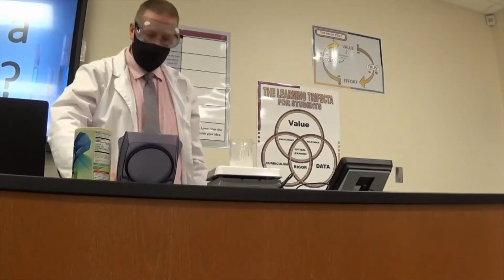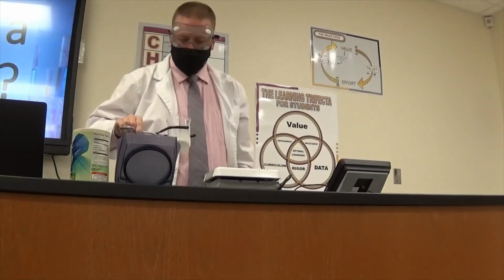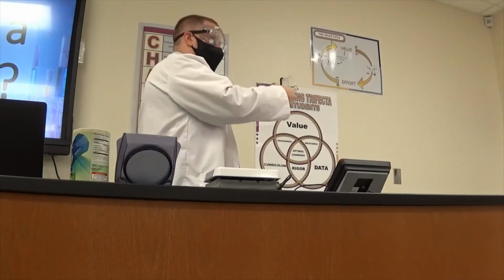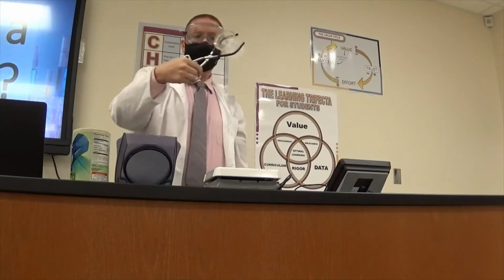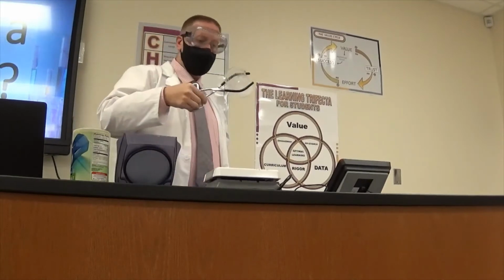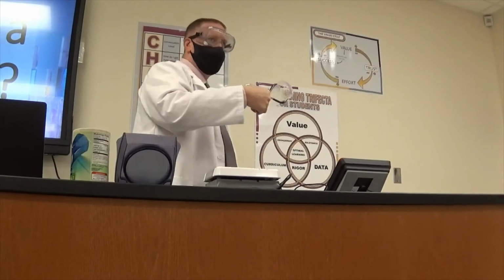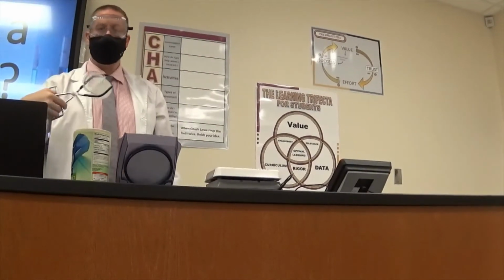So, we've gotten to the point where, and I'm going to take this off of here, because as you can see, all of the liquid has evaporated from our solution. All right? And so what do you see in the beaker? Salt.